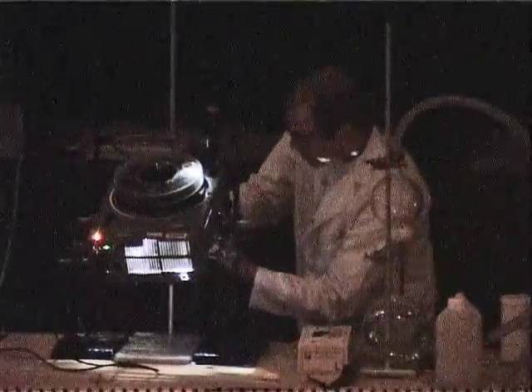This, as it is, is fine until we put some light energy into this.